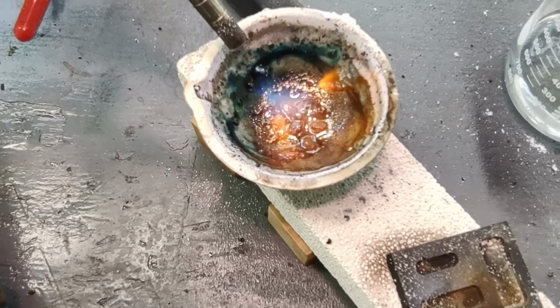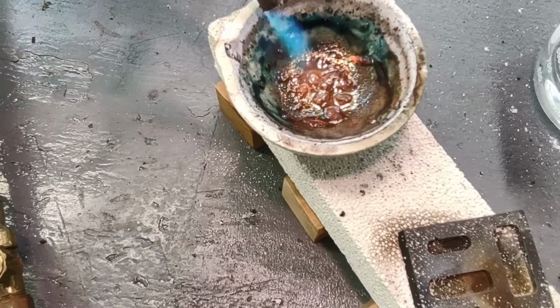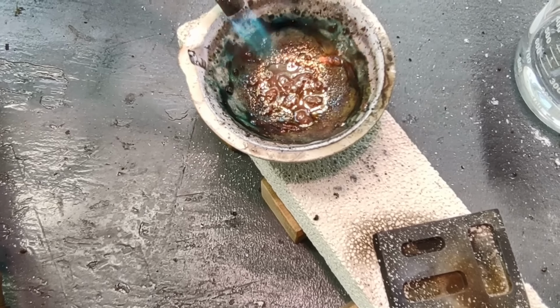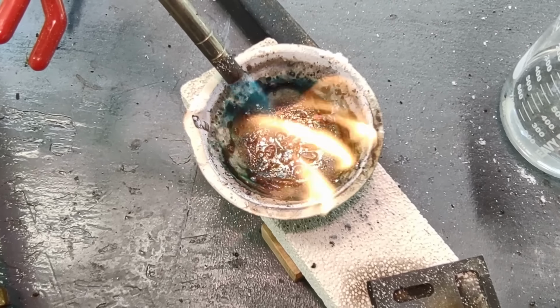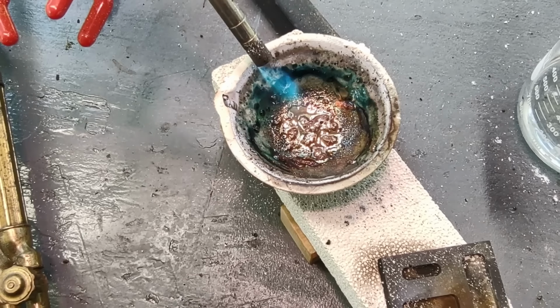Oh, the wind's going to blow my flame out here. What I'm planning on doing here is trying to soften up the borax enough to pull the metal beads out and throw them in a beaker of water. So at least we can try and get a weight on some of these metal beads in here. So we'll see how well that works.